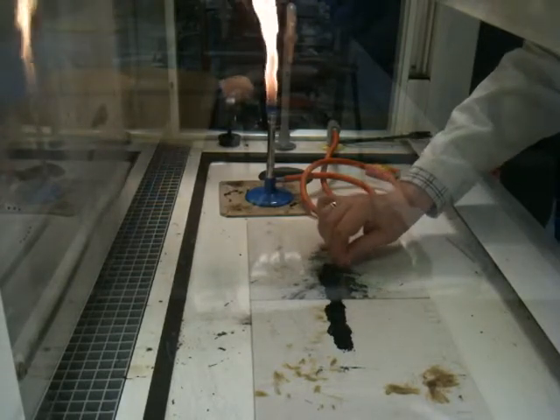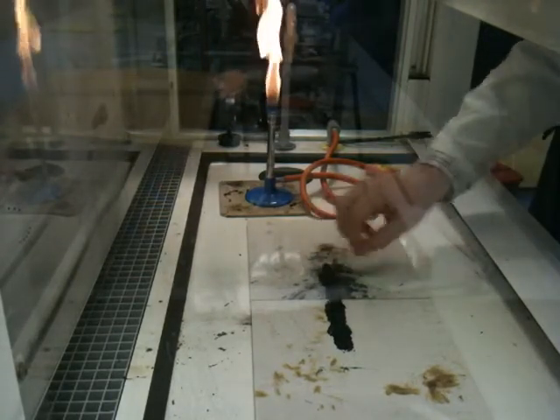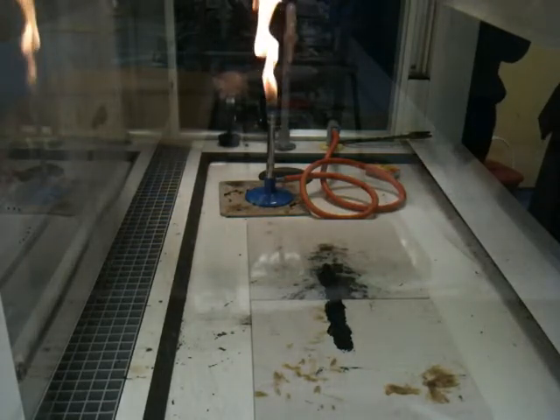Sir, surely if you put it in one pile it might be a bigger reaction and more exciting. Yeah, it explodes better.